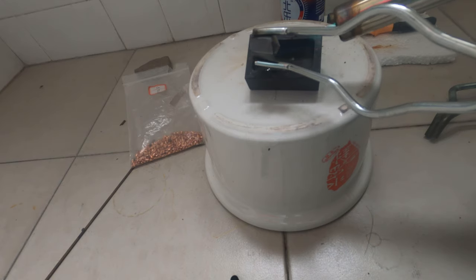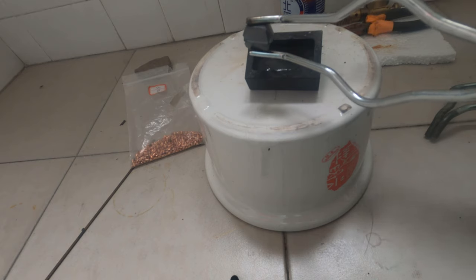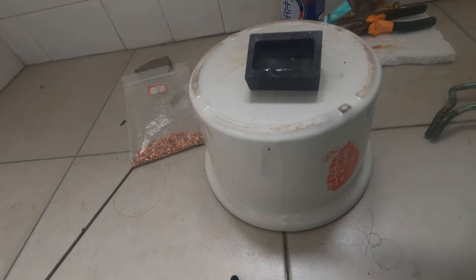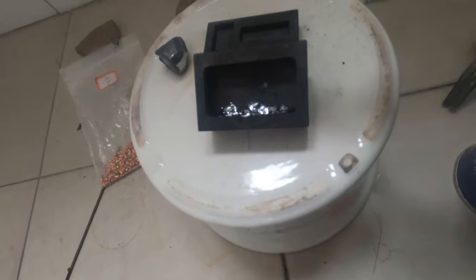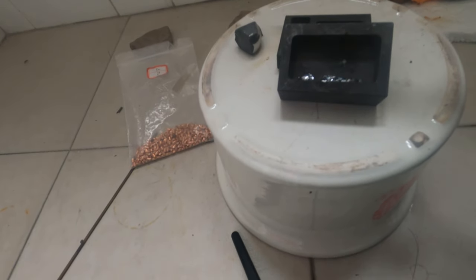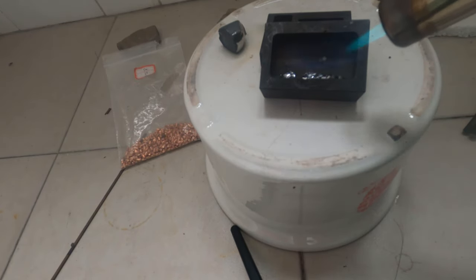Okay, we got some droplets of liquid metal, as you can see. When I think the metal is enough, I cool the lead and pull it back. Then I remelted the droplets to make it become the shape of a bar.